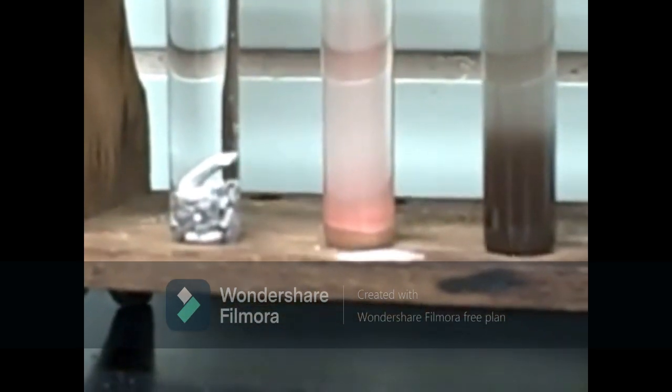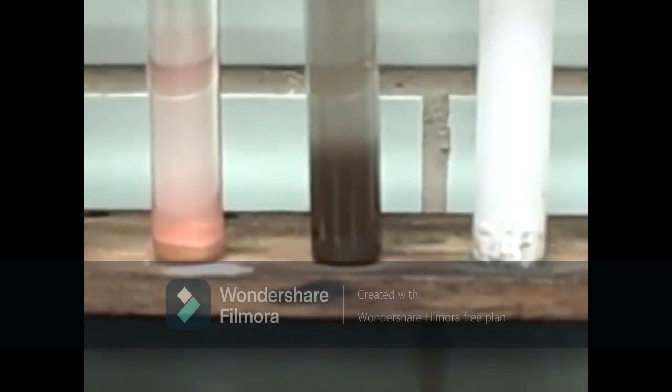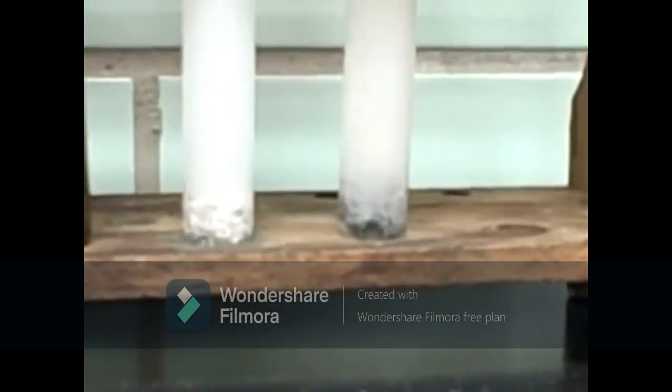You'll see there's a small amount of bubbling in the aluminum. There's no change in the copper. Very little change, if any, in the iron. Significant change in the magnesium, and also significant reaction in the zinc.